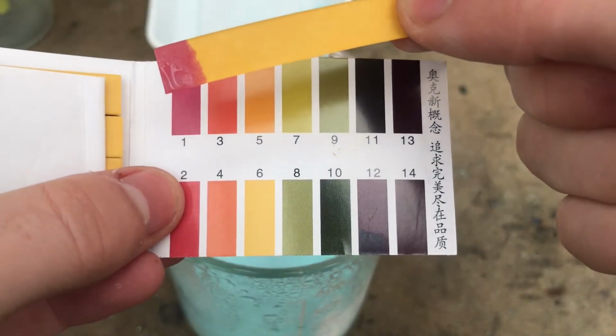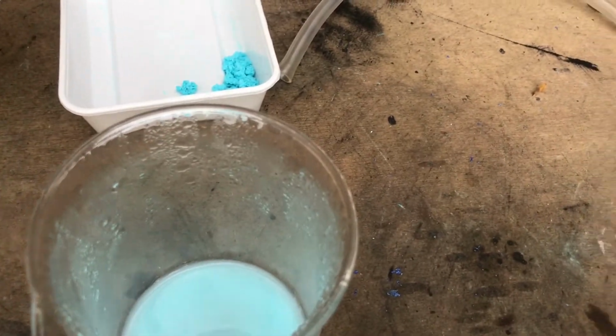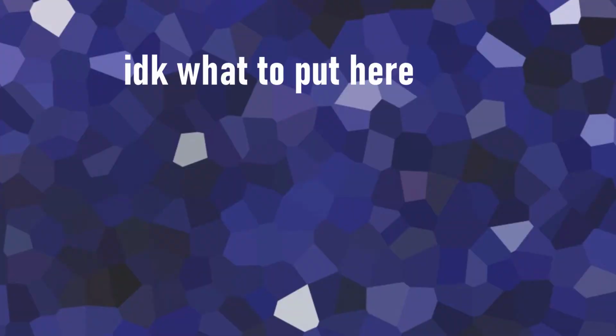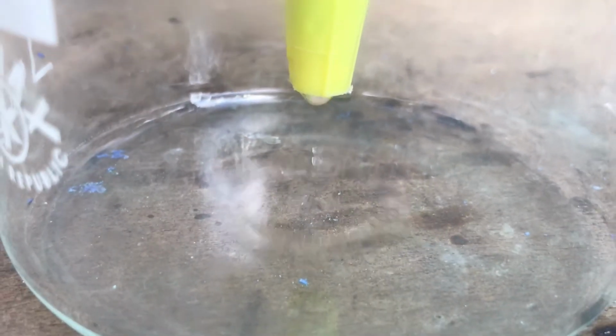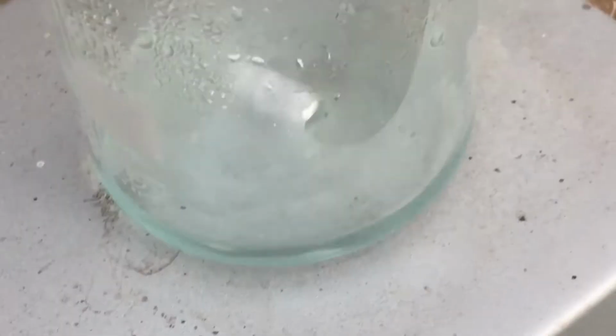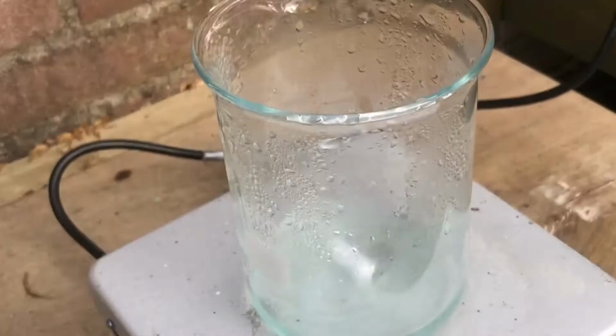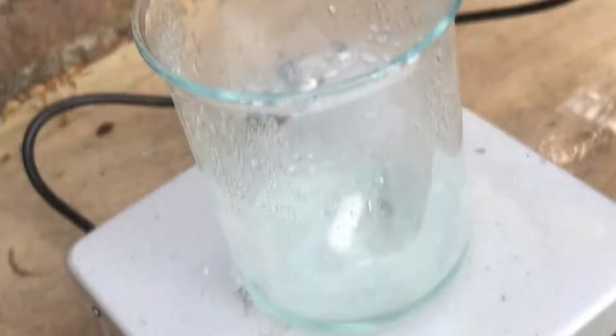As you can clearly see, the pH is very low, around 1. So there's clearly an acid present, which hopefully is some sulfuric acid. Okay, after filtering a second time through some cotton wool, it finally was a clear-ish solution. So let's boil down and see if we can obtain some relatively concentrated sulfuric acid. Just boiling one more time, and then I might have a little bit of concentrated sulfuric acid. Hopefully. That will be awesome.